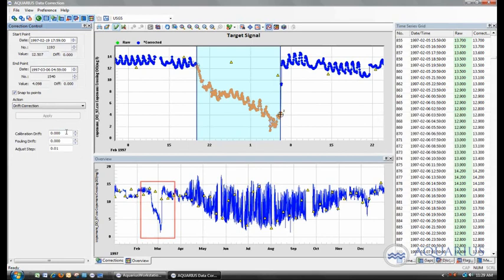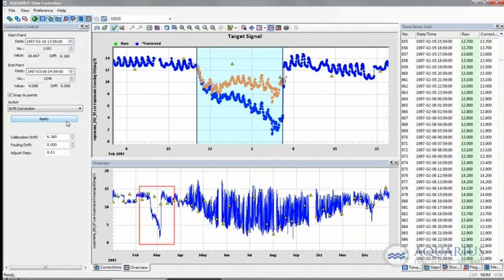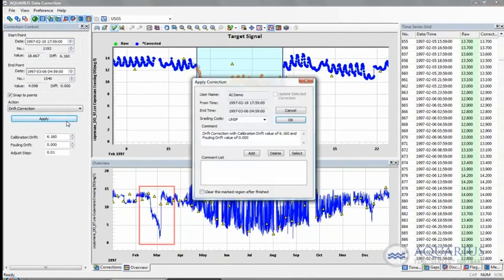So I'm going to apply, let's say, a calibration drift, and I can either type in that kind of value. This will be a prorated drift correction. So I can apply that kind of absolute value that will be applied prorated along that section of data, or I can actually do it manually, visually, by clicking on that endpoint and dragging it up. And I can drag it up onto this kind of area right here. And if I'm happy with that, what I can do then is hit the apply button. And that basically means that I want to apply this correction to that data set.